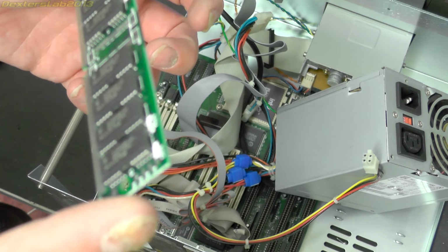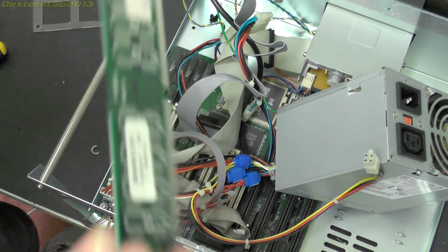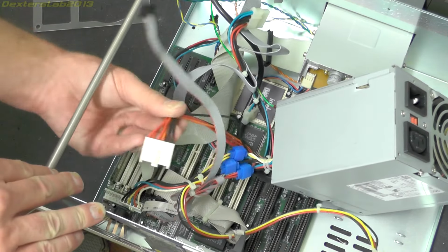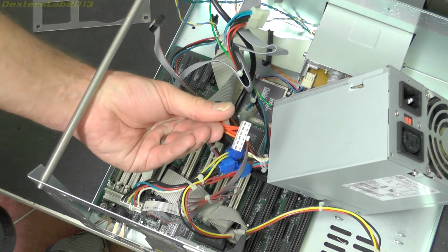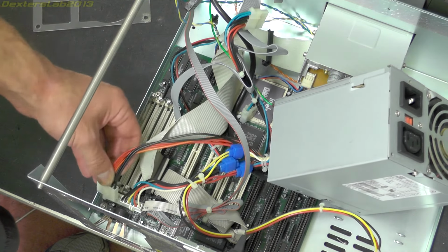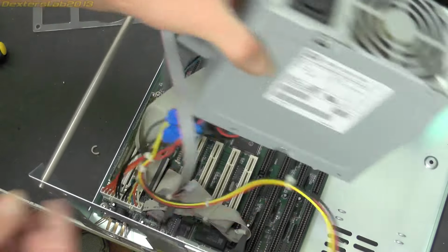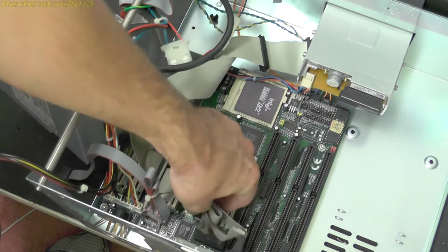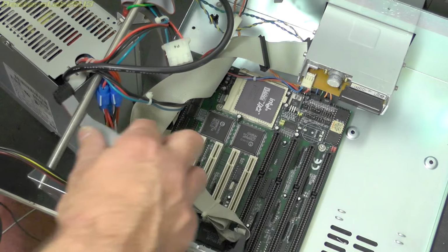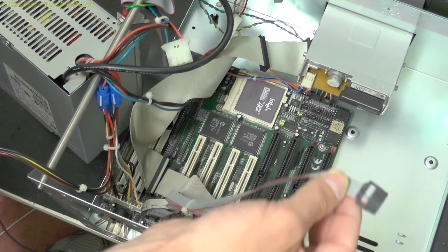Not sure what size it is, no idea, probably 4 meg or 8 meg or something. And yeah, you can see here also the old school AT style power connectors, which were always destined to catch out newbies because you could put them in backwards and that would really ruin your day. So also on here we've got the serial and parallel cables plugged onto the board, and this serial port which ran up to the science part, that is just connected to the board as well.